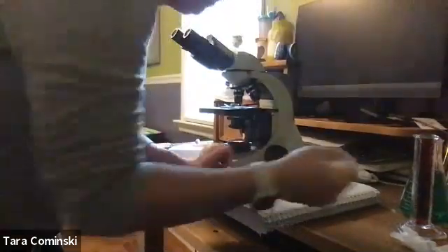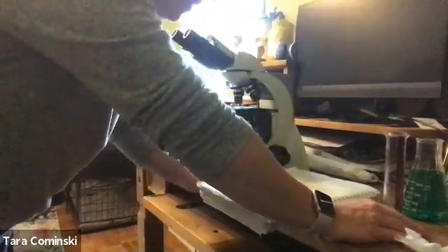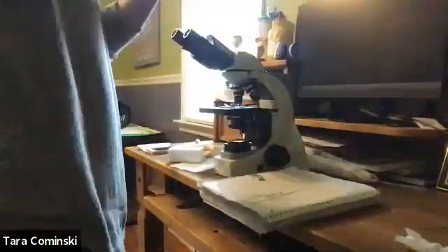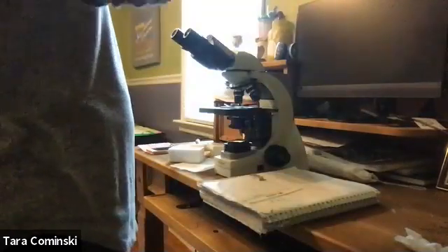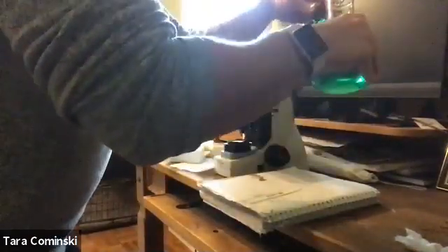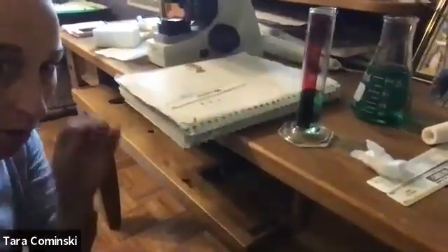I said we usually will measure volume using a graduated cylinder. I already told you that, okay? So now it says, fill a 50 ml graduated cylinder to the 20 milliliter mark, okay? So I'm gonna do that. I have green water. Hopefully it makes it a little bit easier to see. Oops, I did too much. Right, so just about right. All right, so I filled my graduated cylinder here to the 20 milliliter mark, all right?